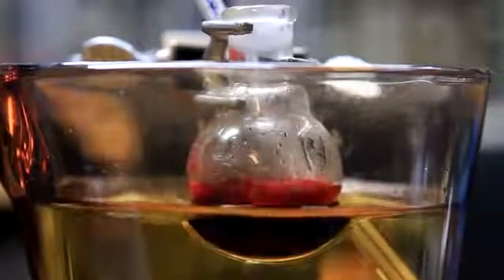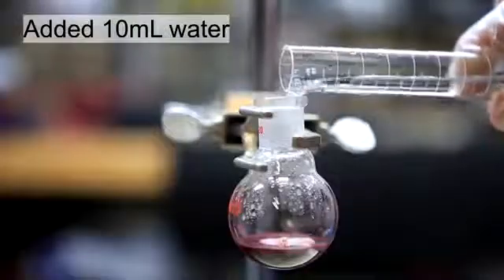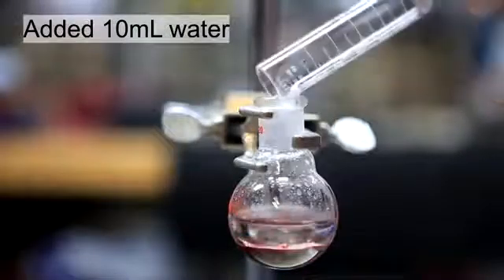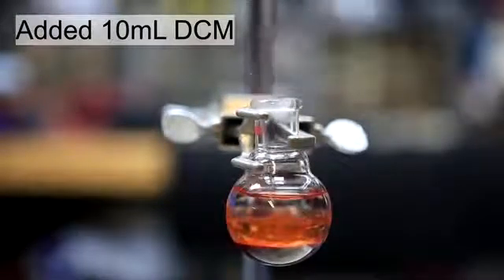After 2 hours, the flask was removed from the oil bath and allowed to cool to room temperature. Once it had cooled, 10ml of distilled water was added. This was followed by 10ml of dichloromethane.